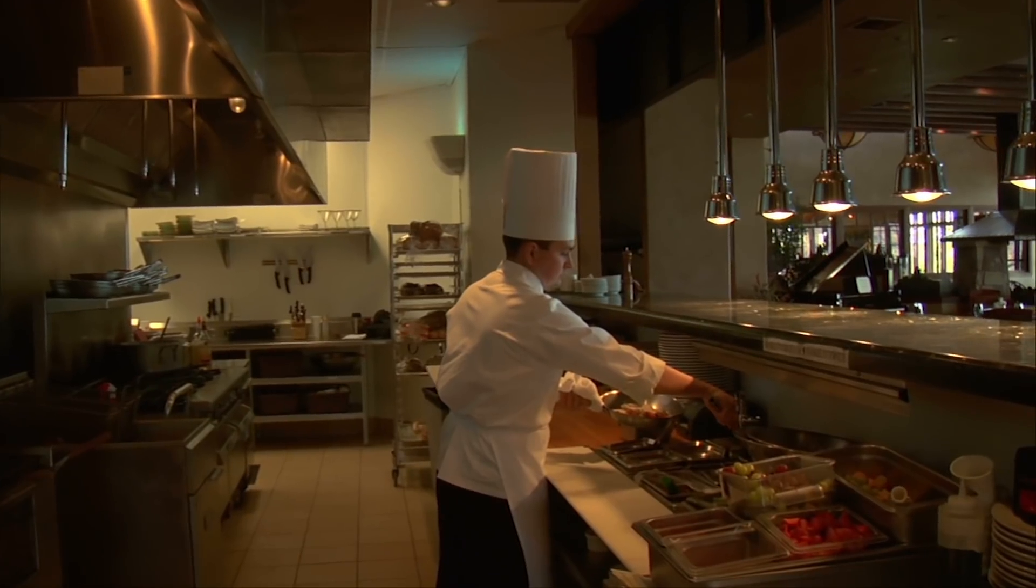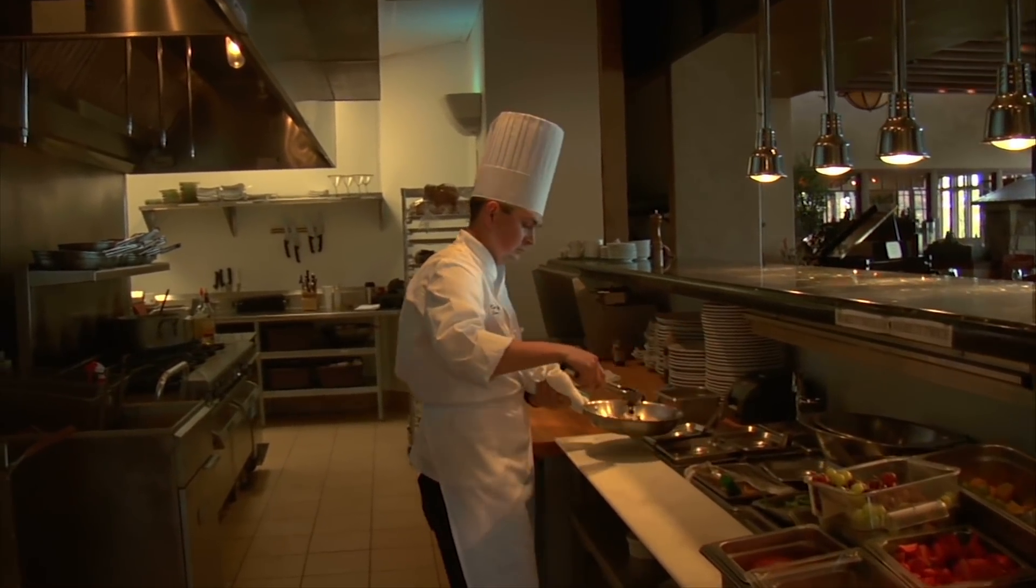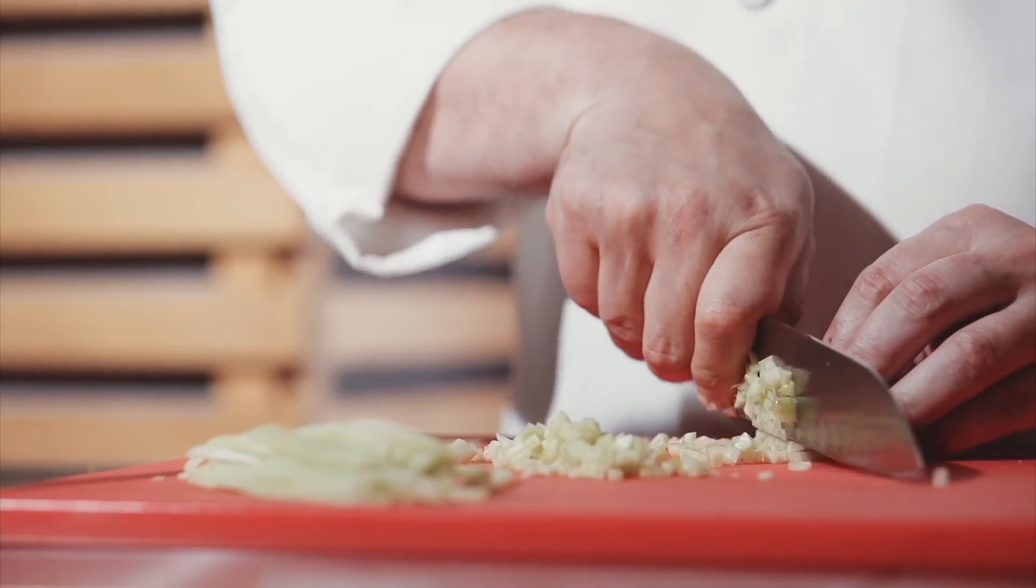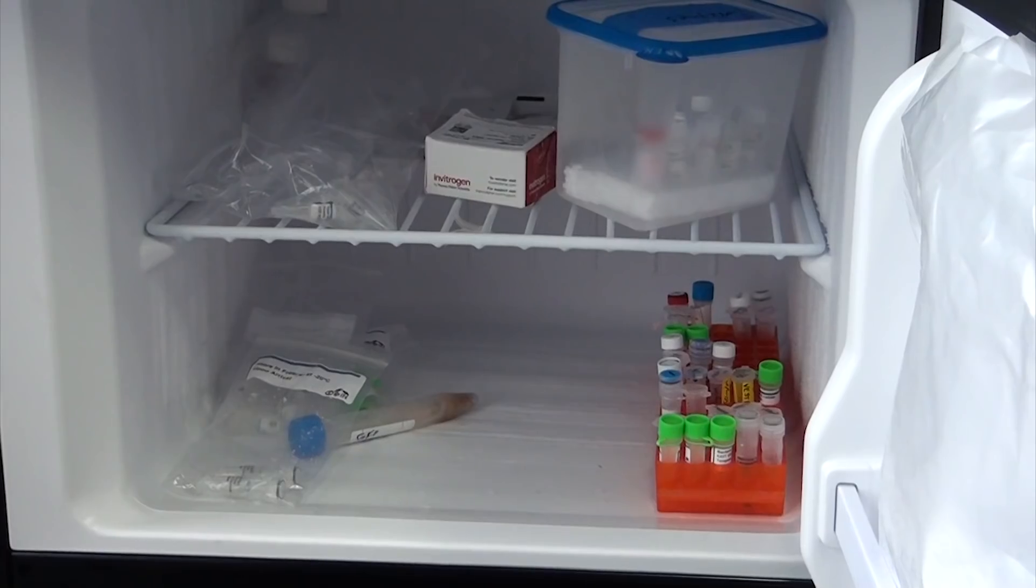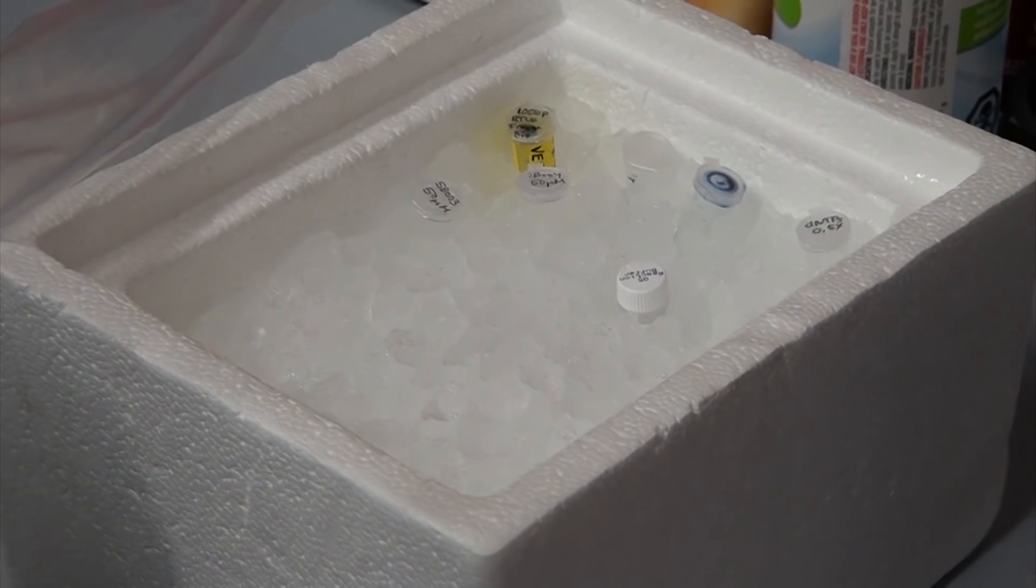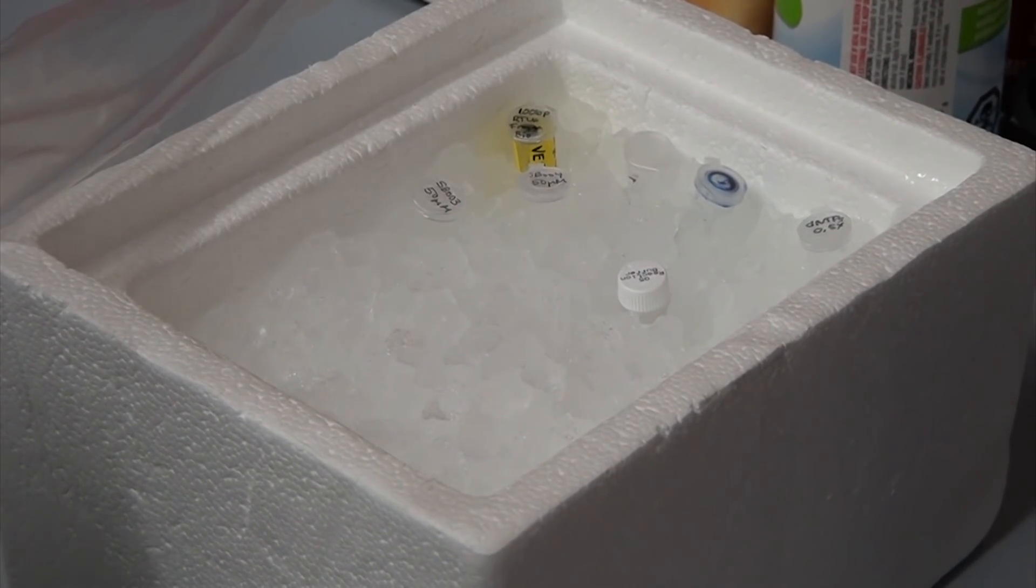Doing biology work is a lot like cooking. You're always following a recipe, but there are countless potential tweaks and variations you can make to change the final outcome. With biology, every technique has half a dozen variations, and the ingredients are made by dozens of manufacturers, each with their own custom blends of compounds for the task at hand.